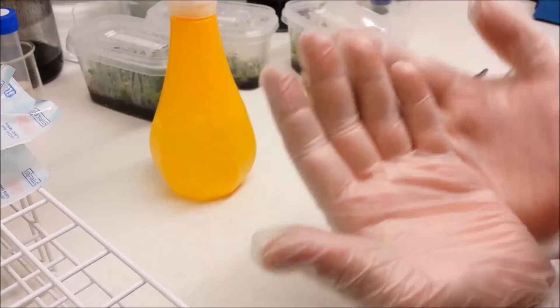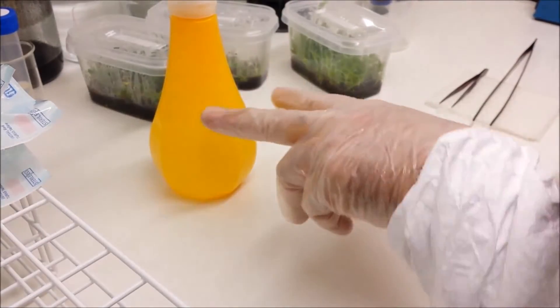For the rest of the video I'll just say IPA to keep it simple. Everything inside this area is sterile.